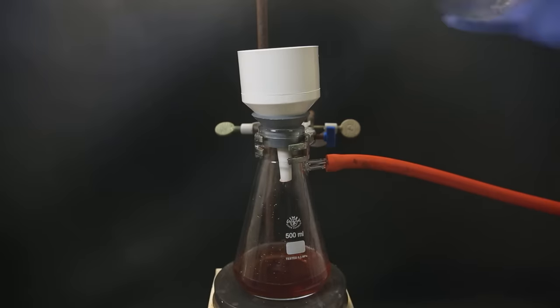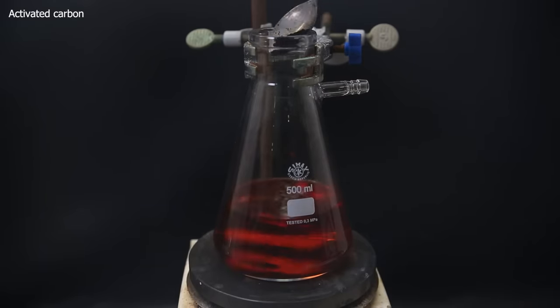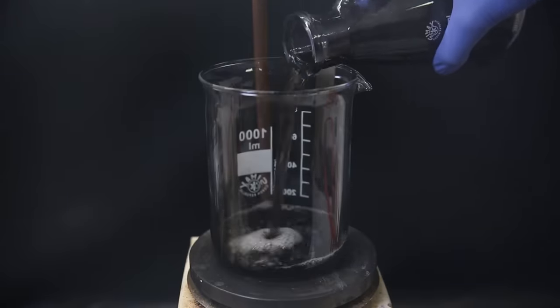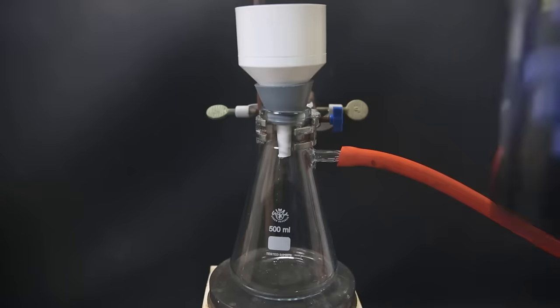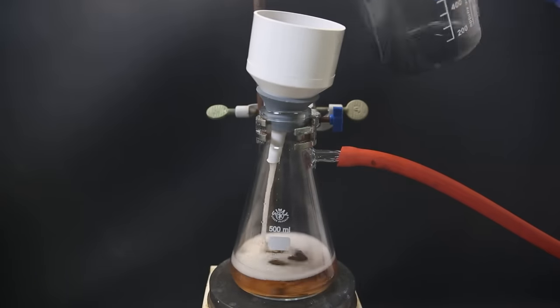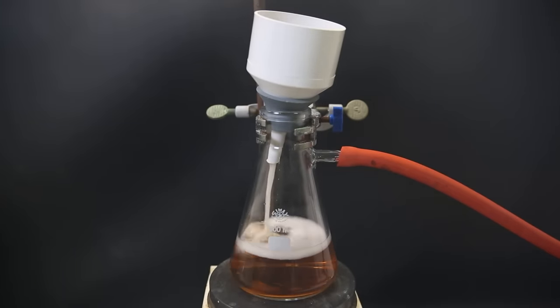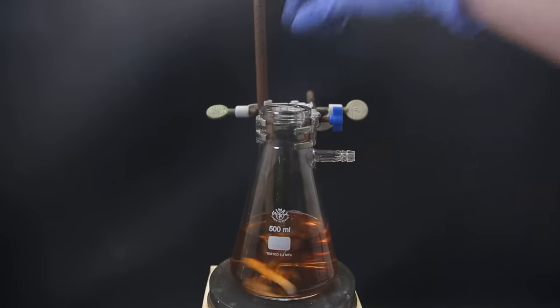So I wash it with methanol and the filtrate becomes red. Now we don't really want this red color. In the procedure, they filter it through activated carbon cartridges with quite a long contact time. I don't have those, so I will see if stirring it with activated carbon for a few hours will manage to remove it. When that is done, I pour it all into a beaker and then filter it again. The filtrate comes out more orange than red. Well, at least it's no longer red, so that's an improvement. I will just use it like this for the next step.